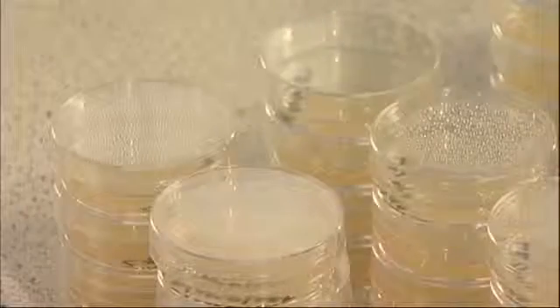Allow the plates to set. You can leave the plates at room temperature for 1 or 2 days to allow extra moisture to evaporate, and the plates will be more absorbent during the experiment. This is not vital, though.